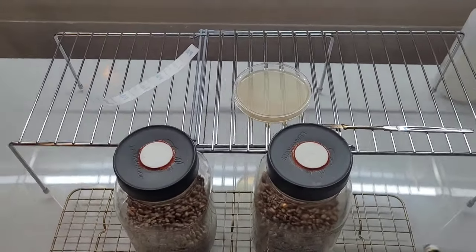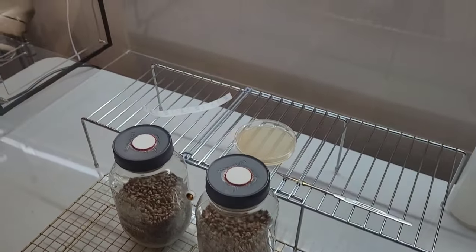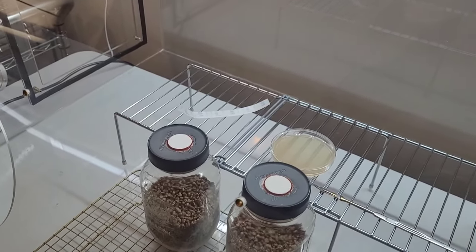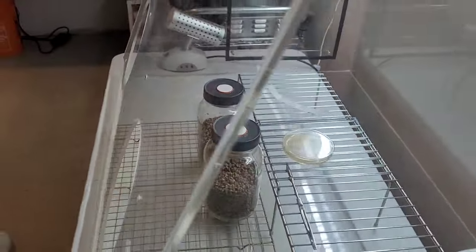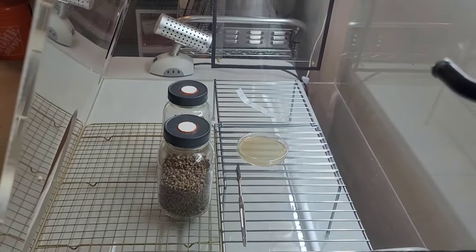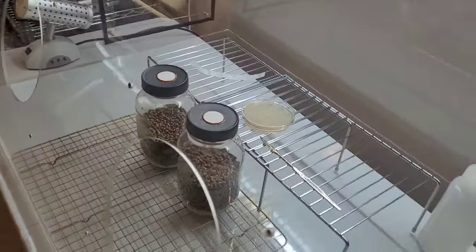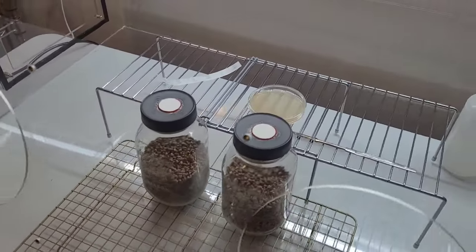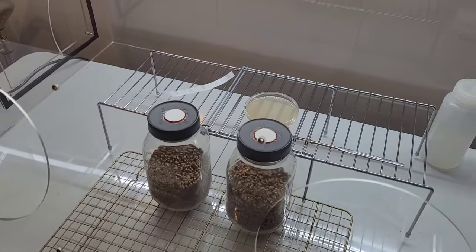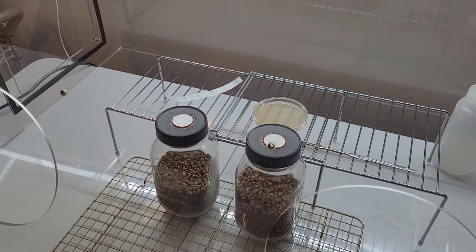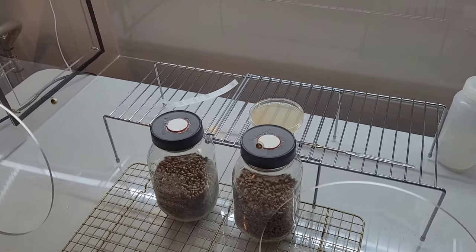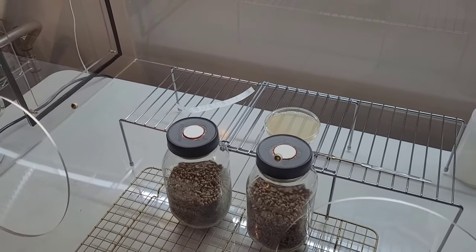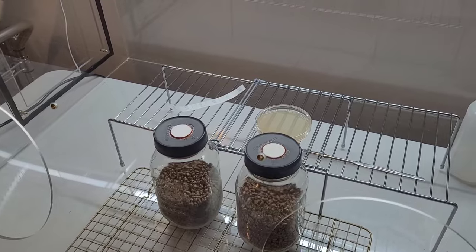Now this is probably the time when I should add that still air, as mentioned before multiple times, is still air. Gravity and still air is what wins the game here. Adding any number of contraptions like filtered blowers, you name it, whatever it is, anything that disturbs the interior still atmosphere of your still air box defeats the purpose of a still air box.